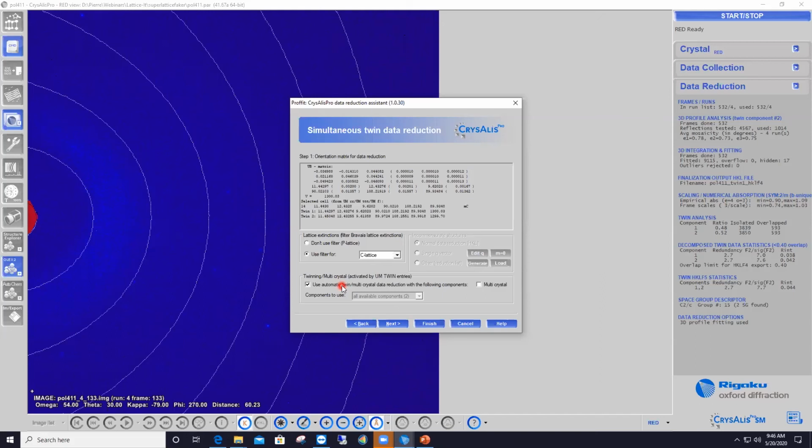And that was done automatically by CrysAlisPro because obviously it knows what we just did in the lattice wizard, that we indexed the diffraction pattern as the two-twin component. And at this point, I'm ready to go ahead with data processing, and there shouldn't be any problem after that. Okay, I'm gonna stop here.